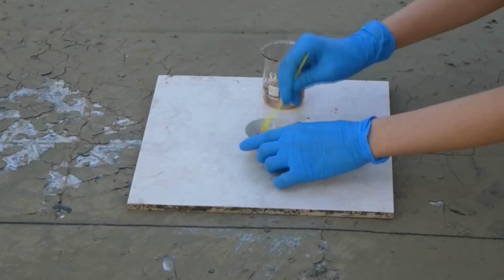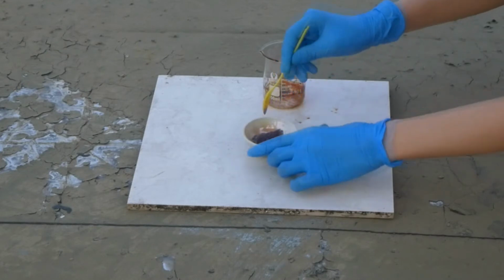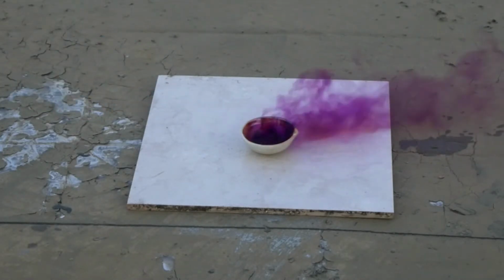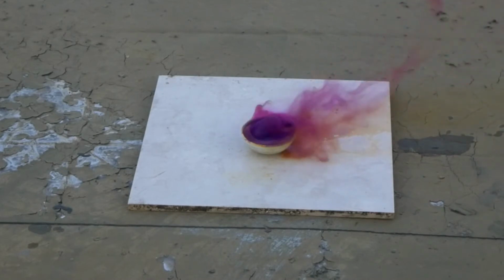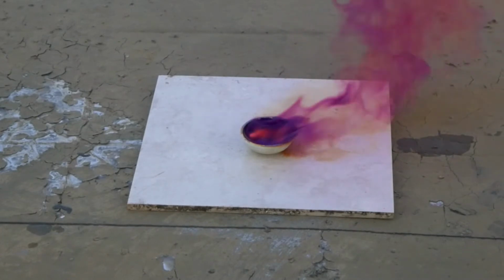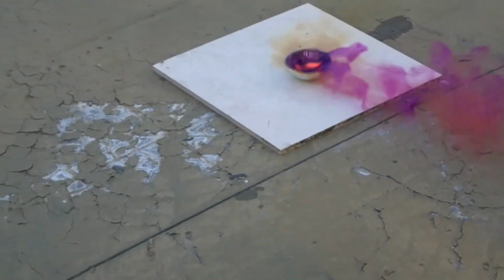Actually, the reaction started, but it's really slow. To fix it, just add some water. The water will dissolve a little bit of iodine and mix the two reactants to increase the rate of the reaction. As you can see, immediately lots of purple vapor is coming off. Inside the crucible, a red flame appeared. Aluminum reacts with all the halogens, but its reactions with bromine and chlorine are much more violent.